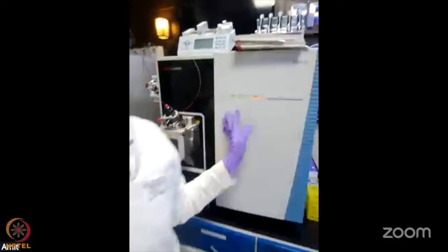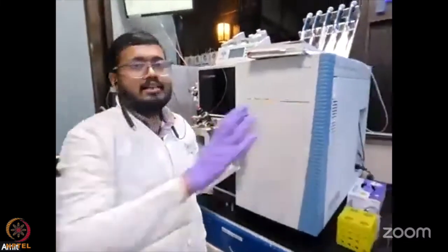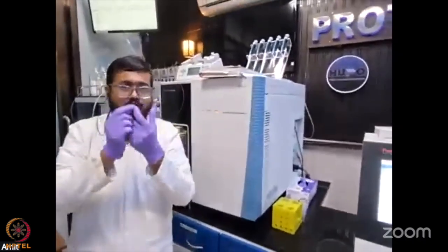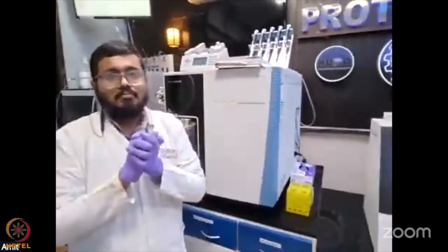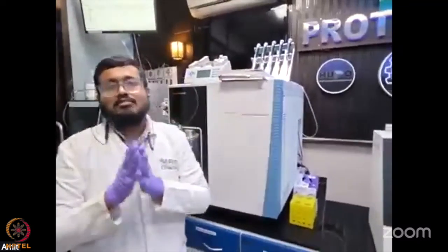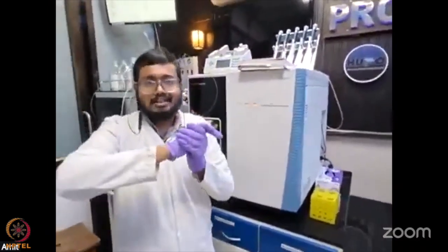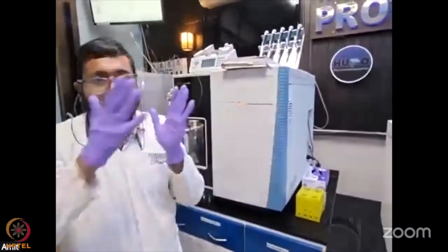Now, the major difference with the triple quadrupole mass spectrometer is that we are talking about different mass analyzers. We need two mass analyzers. Just focus on the name, triple quadrupole. Don't get mistaken by the name that it contains three quadrupoles. It contains two quadrupoles, and in the middle is one collision cell. We have already spoken that the quadrupole filters the precursor ions. Now there is a collision cell in between, and there is a third quadrupole.